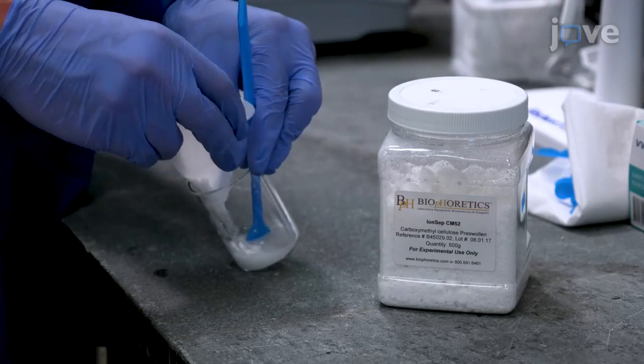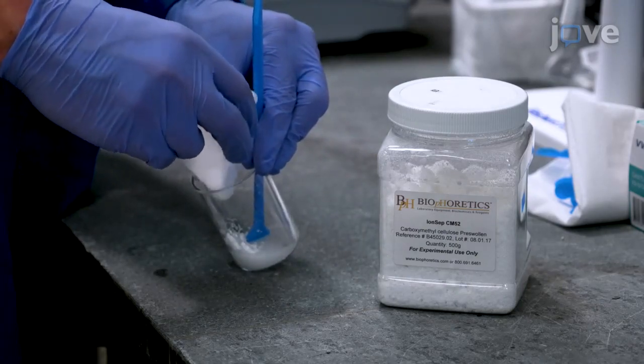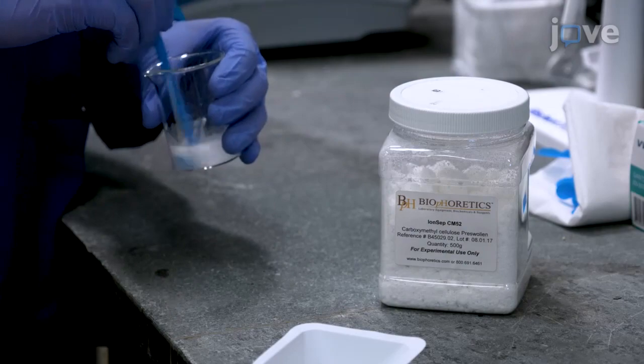Add and stir 0.844 grams of water-insoluble pre-swollen carboxymethylcellulose resin to the beaker.